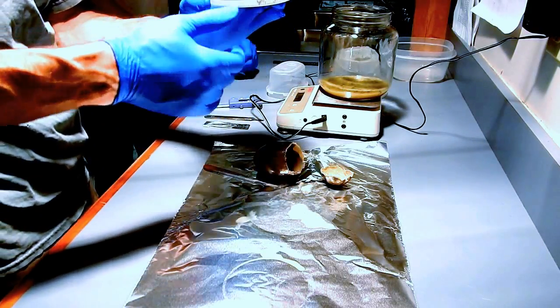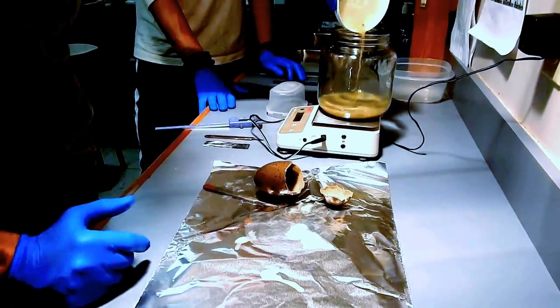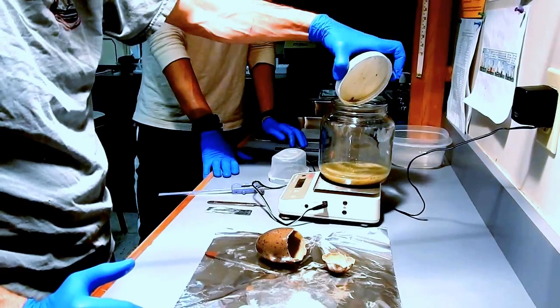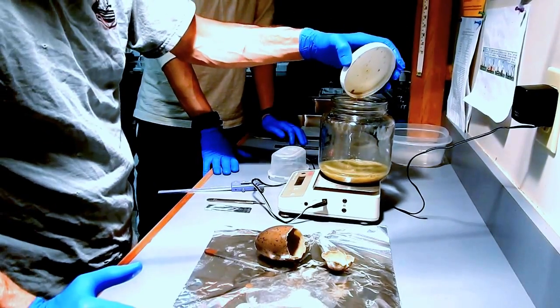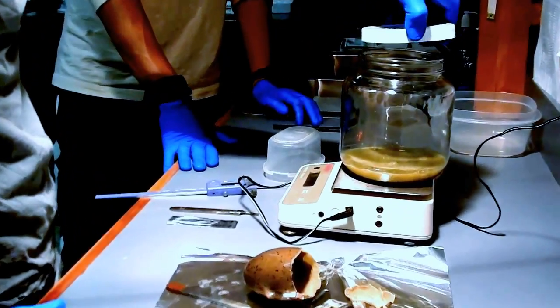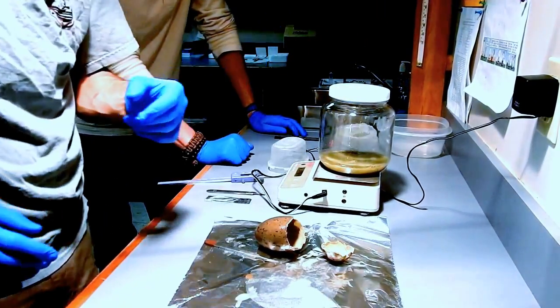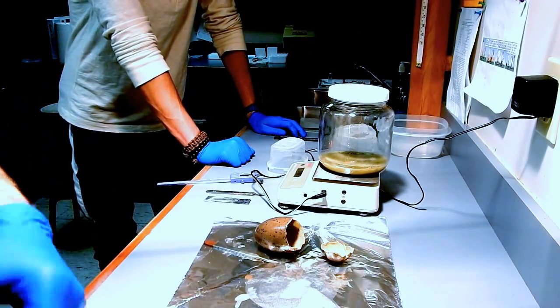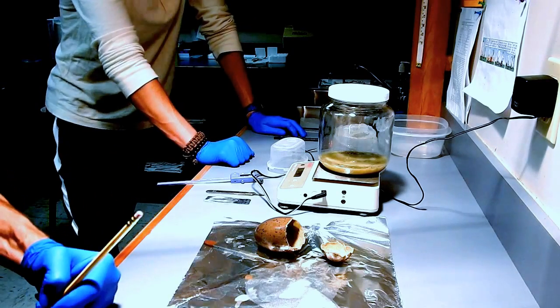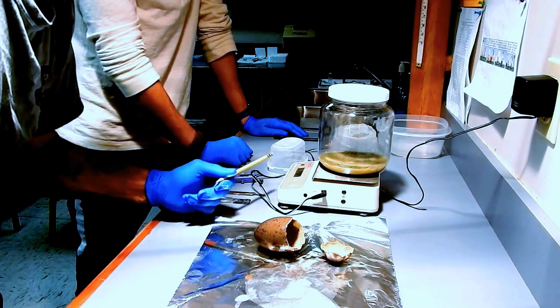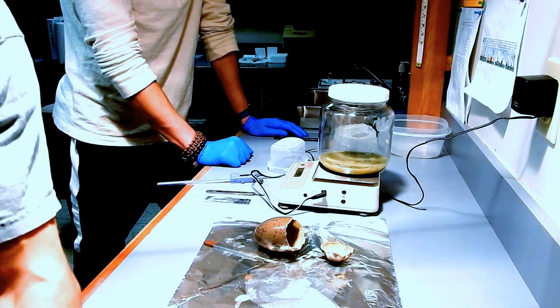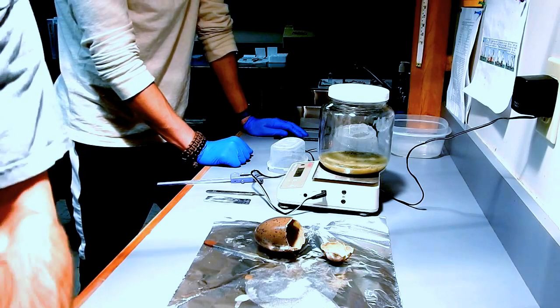All right. So let's skip that in there and write down... I'm going to write down that raw weight on here for now. And you don't have to read it out.